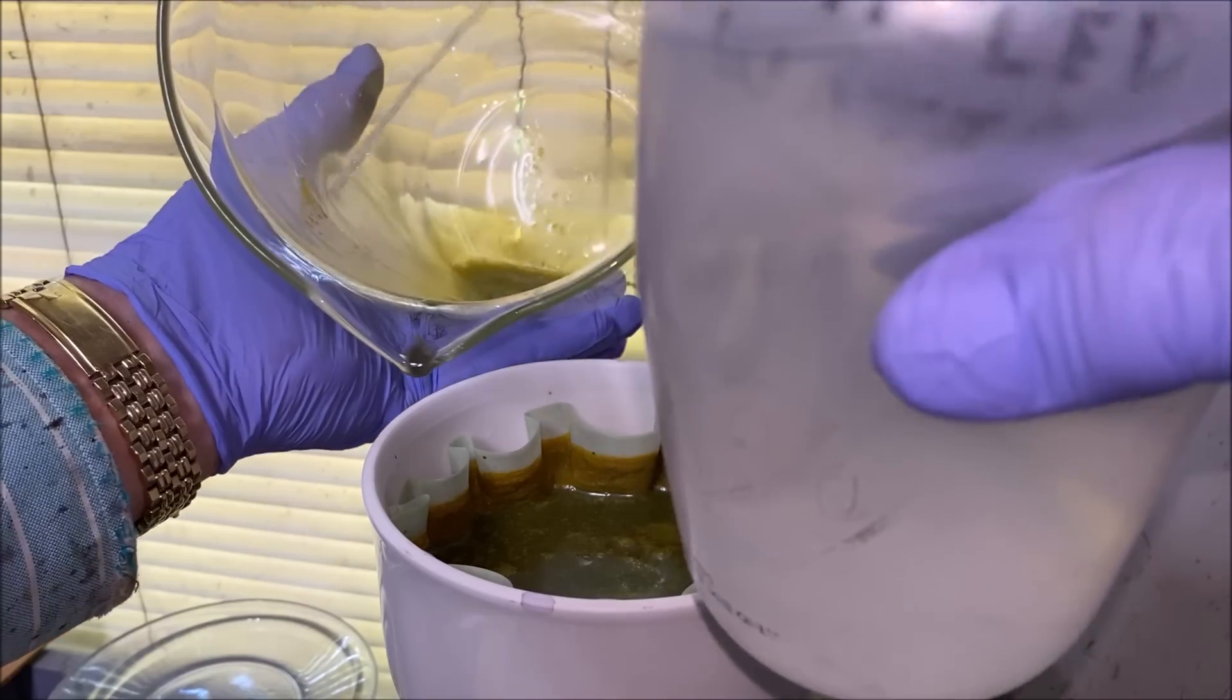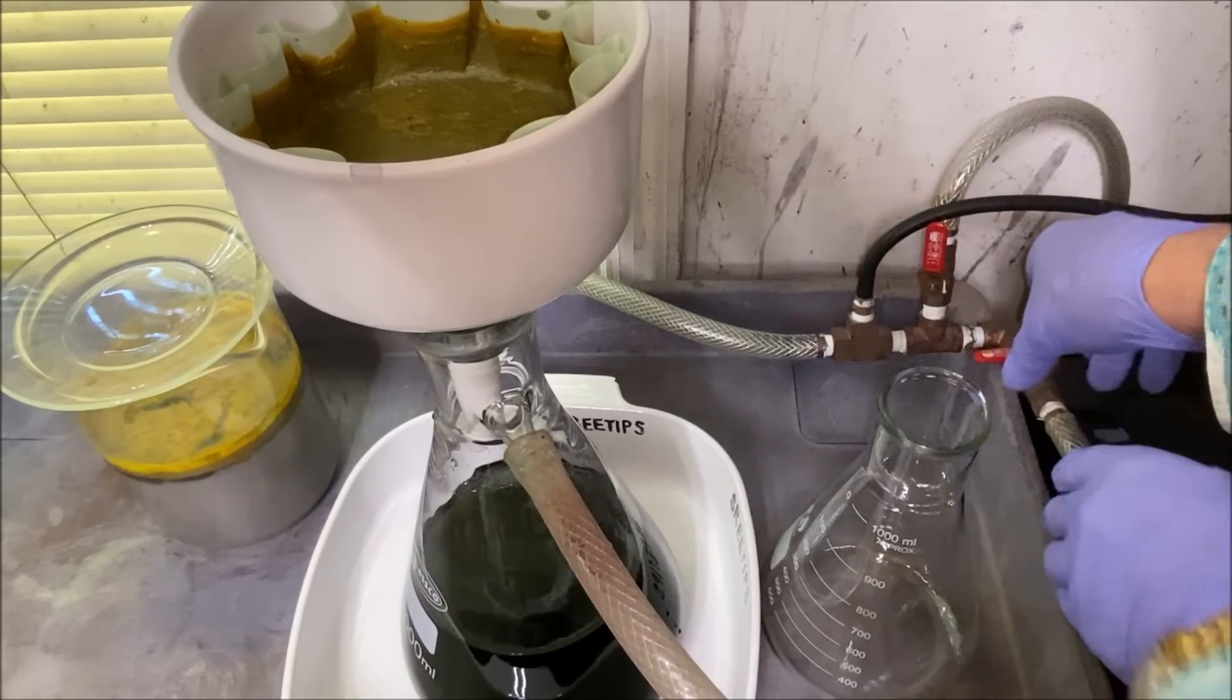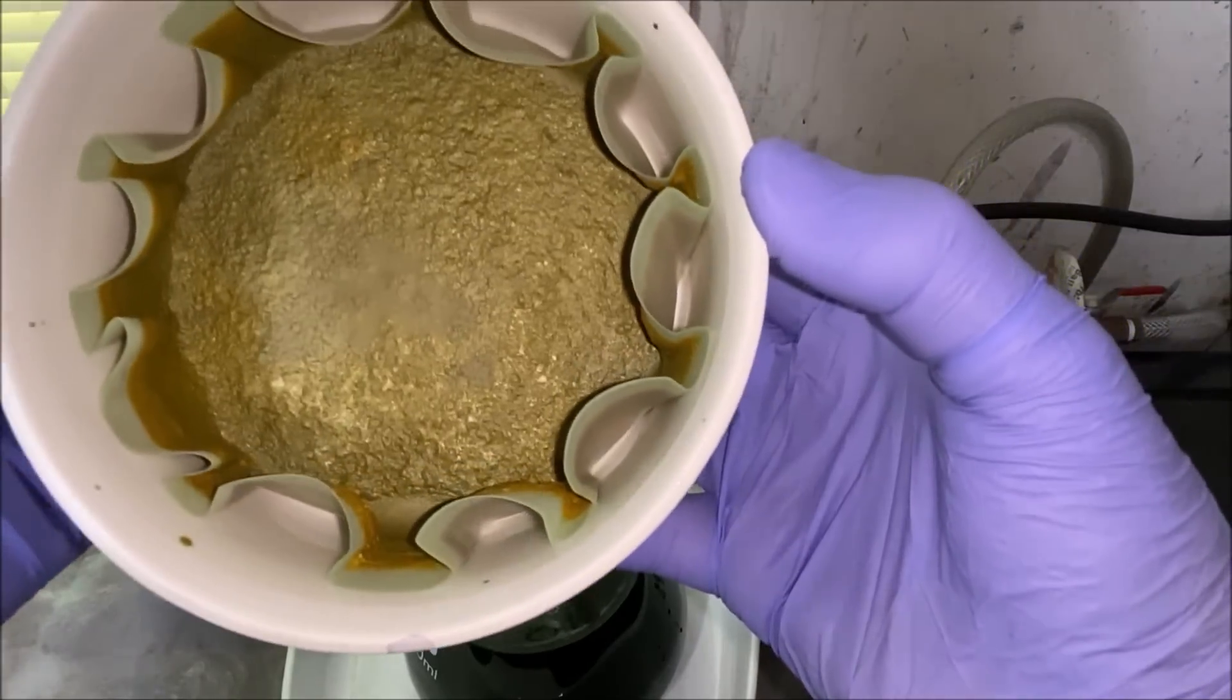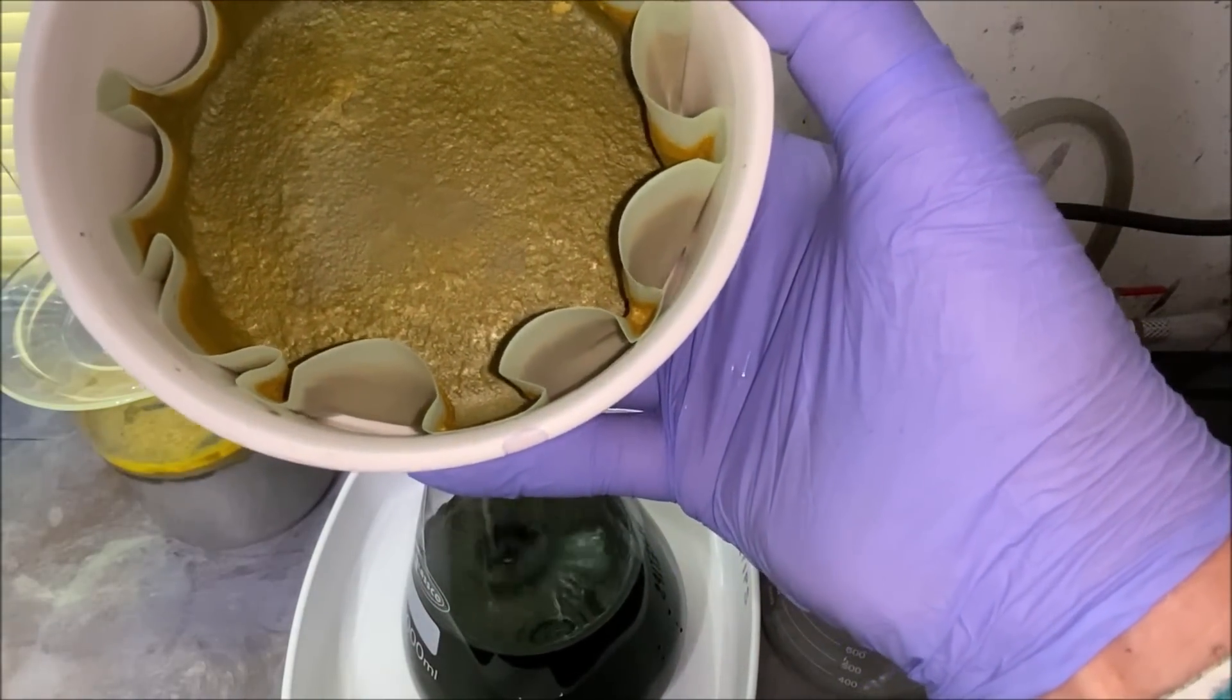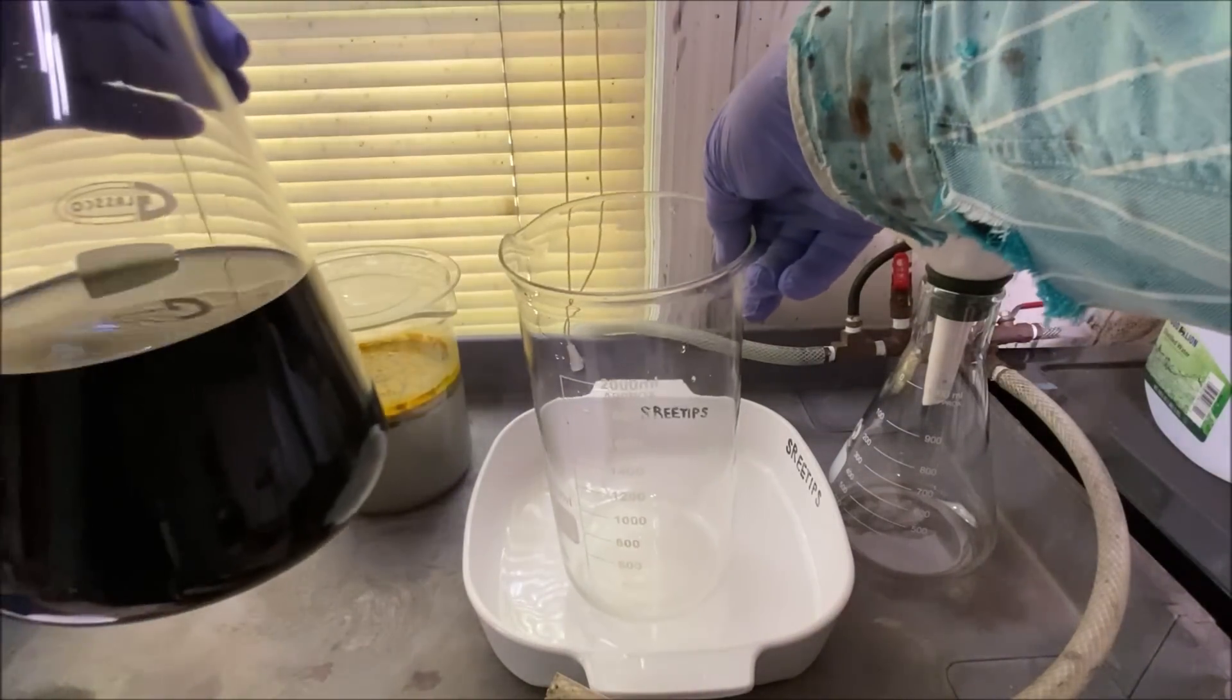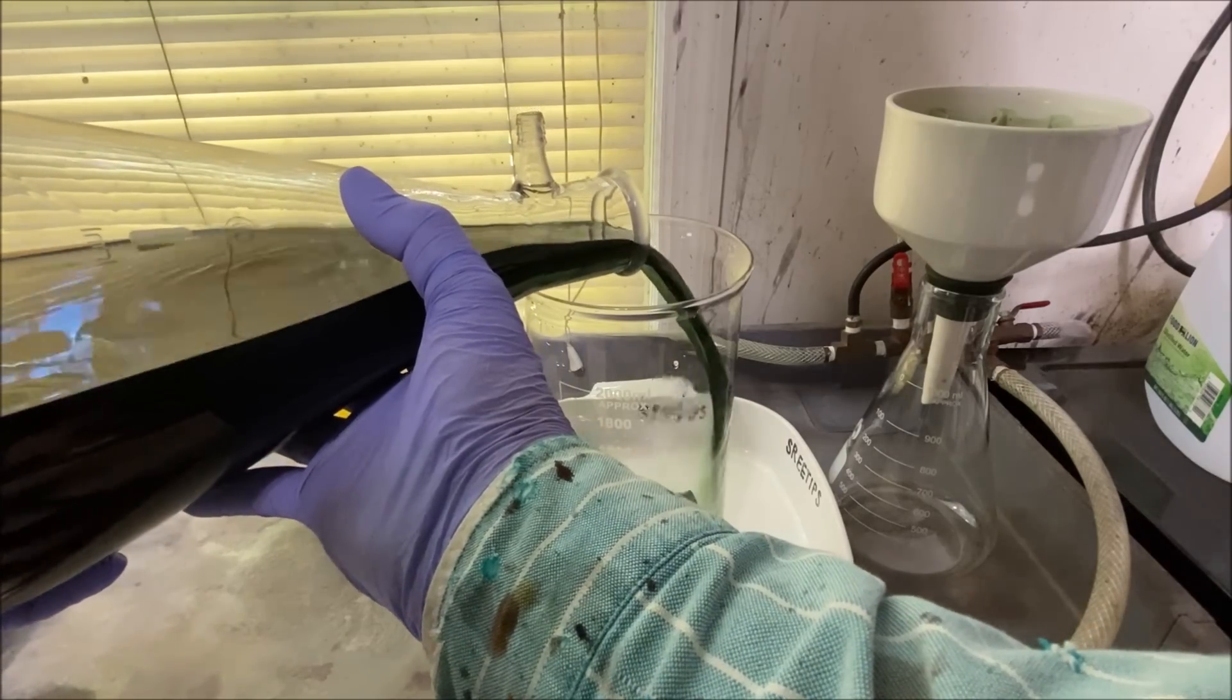I'm down to the bottom of the beaker. Looks like we got silver in with our palladium precipitate. I'll take the filter off, that's our precipitate. It looks gray because there's probably some silver in there. Here's our solution that we just filtered into this funnel. I'm going to add it to a clean beaker and set it off to the side.